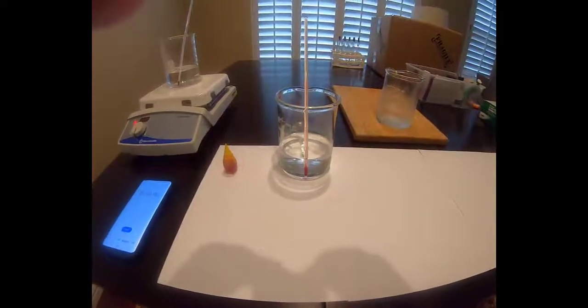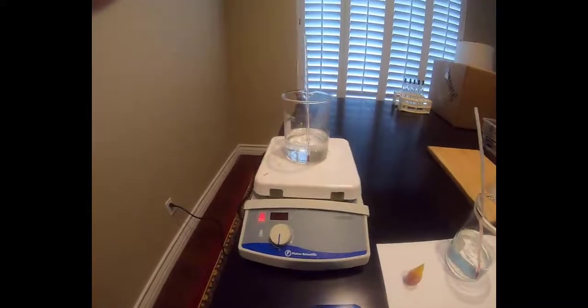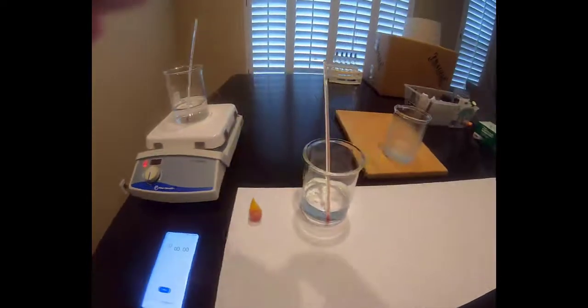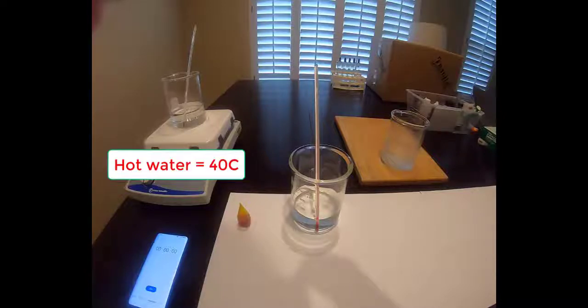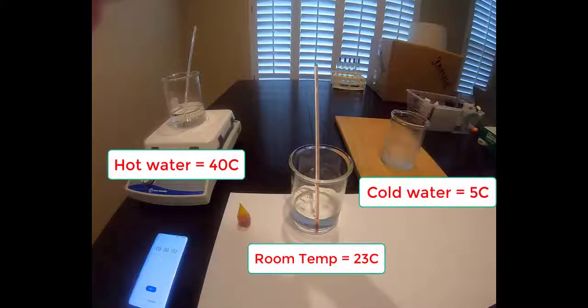Now let's begin our first experiment. Here we have our 3 beakers. This one has ice water, here is our room temperature water, and here is our hot water. You should record the temperature of each beaker's water in your chart on page 3 of your handout. Here are the numbers you should record. The hot water, or body temperature water, was 40 degrees Celsius. The room temperature water was 23 degrees Celsius, and the ice water was 5 degrees Celsius.